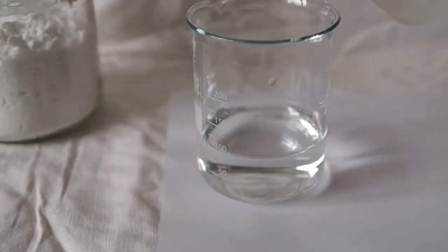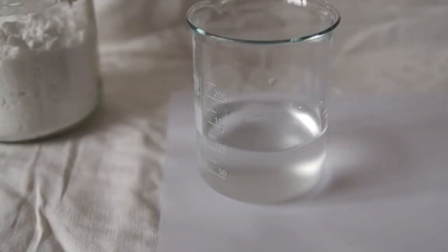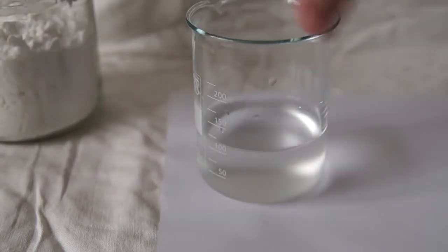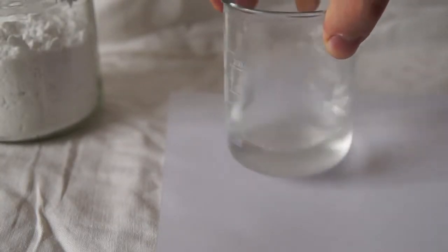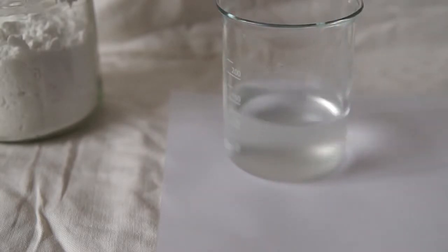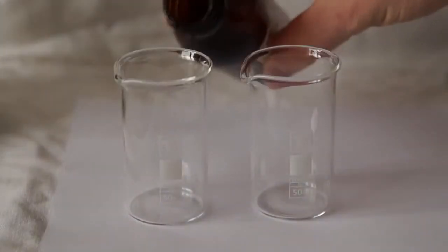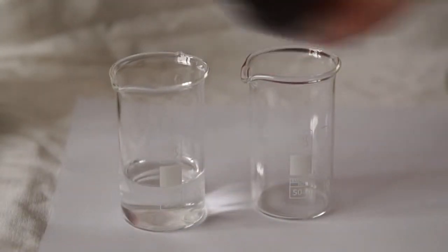Next, pour the starch solution into the first solution, where we have a mixture of potassium iodide and sodium thiosulfate. We get a slightly cloudy solution. Next, let's make a second working solution.